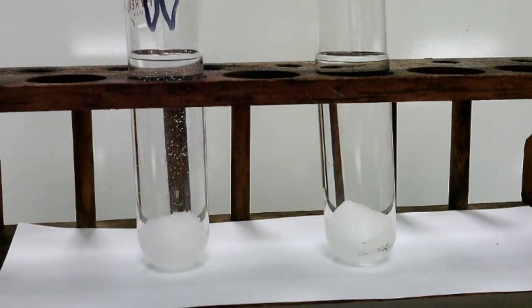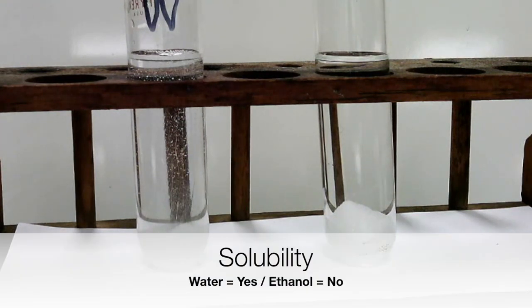When we zoom in here, we can clearly see the sugar cube in the water losing its shape, little bubbles are coming up, and it is definitely dissolving, which is what we would expect to happen. But in the ethyl alcohol, absolutely nothing is changing about that sugar cube. So we'd say that sugar is soluble in water, but it is not soluble in ethyl alcohol.